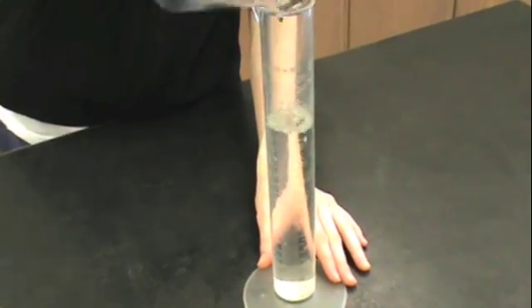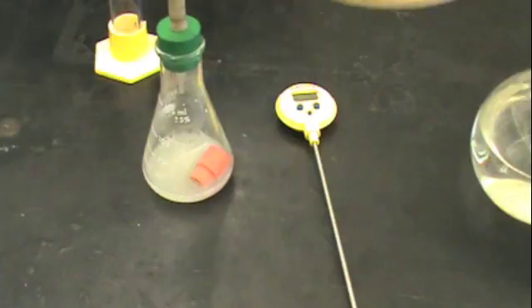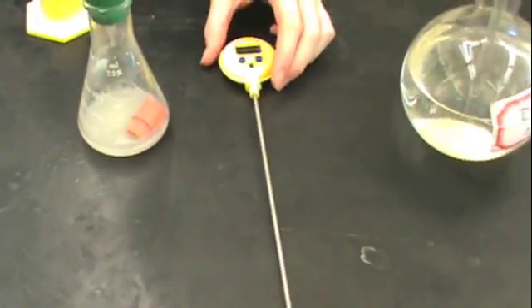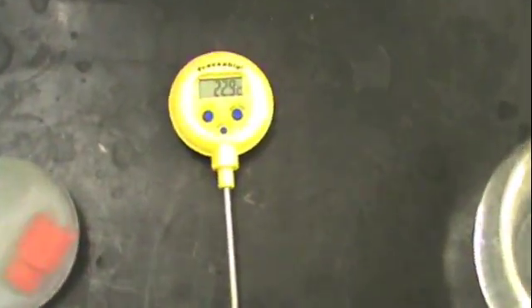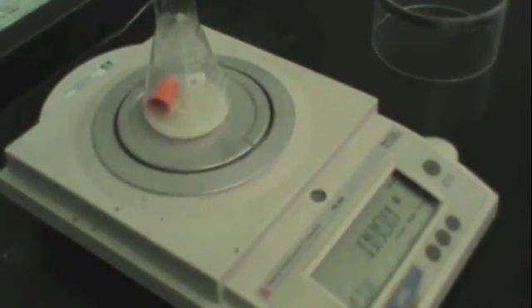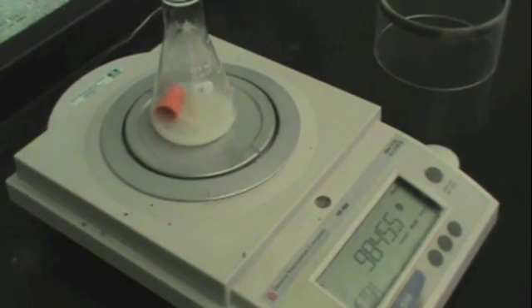Make sure that you release any bubbles that are present in the Erlenmeyer so you get an accurate reading. Now you want to obtain a temperature of the room. Record this value in your datasheet as well. Disconnect your Erlenmeyer and bring it to the balance room. Obtain a mass and record this in your datasheet. This will help you determine how much oxygen was generated.